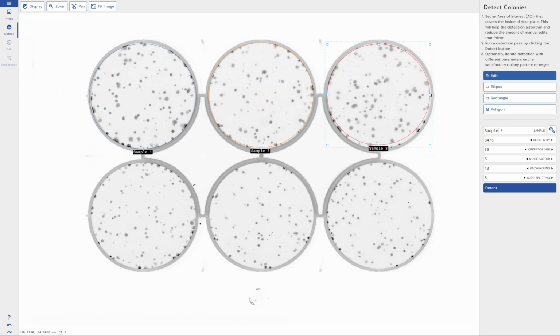You can rename them within this box, and each of them can have a different sensitivity for detection. So we've got a number of different sensitivity tools for each different section here, but if you just use duplicate sample, it will use the same settings from each well. So what you might want to do is get one well perfect for its detection settings, and then just duplicate everywhere else. Or you might value having different detection settings for different wells.